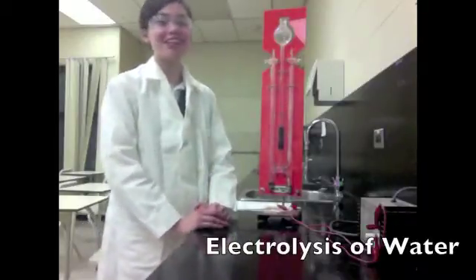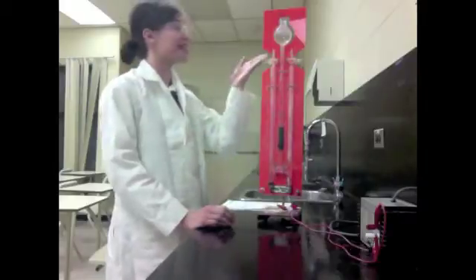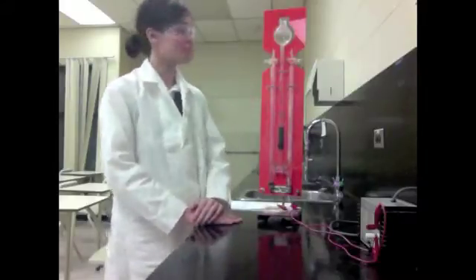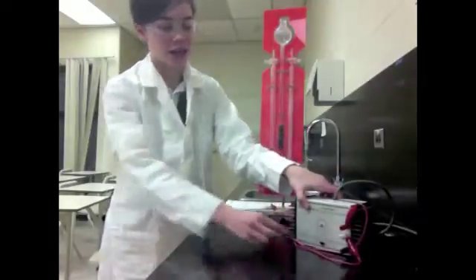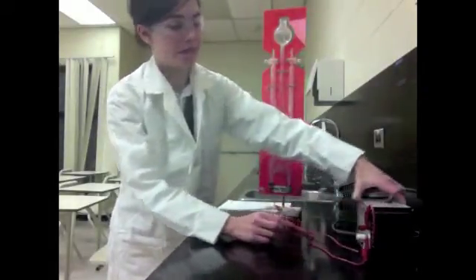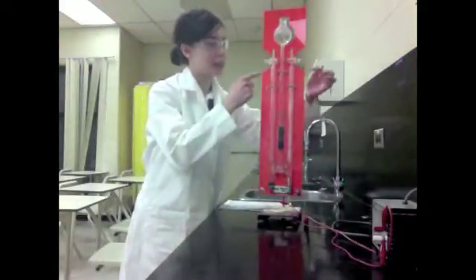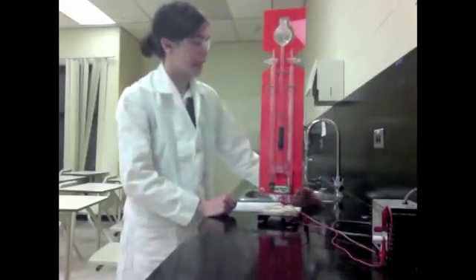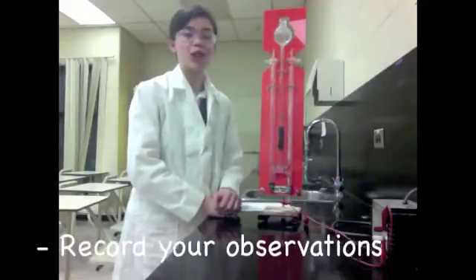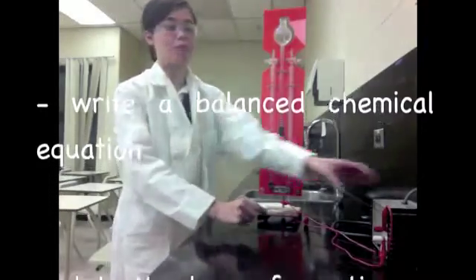Hello class, my name is Danielle and we're going to observe the electrolysis of water using this handy dandy apparatus right here. Now the water should already be in here, just simple water. And we're just going to turn this on and observe the bubbles. We are collecting the gas into these two tubes right here. And note the two different volumes of the gases. Record your observations into your lab. Remember to turn this off.